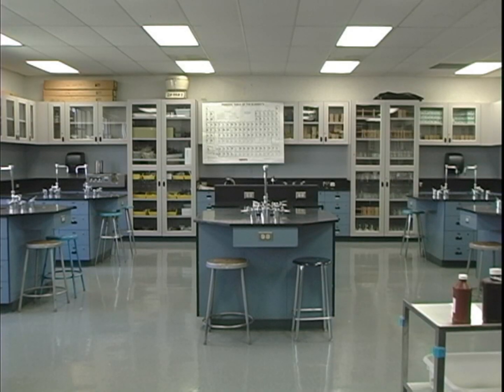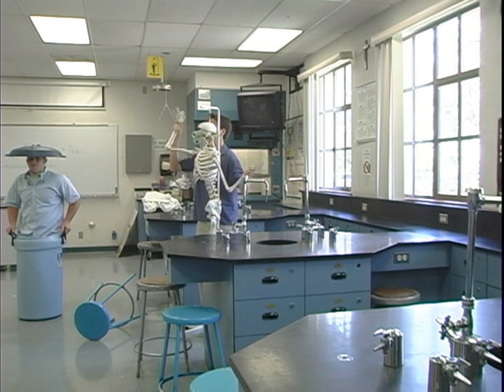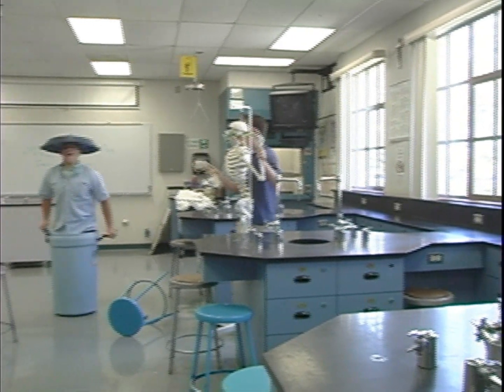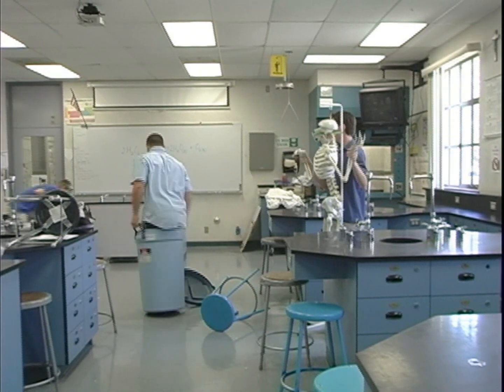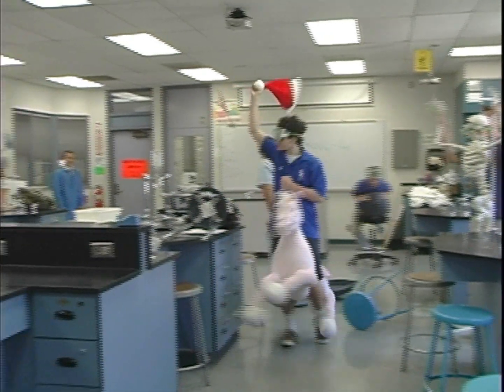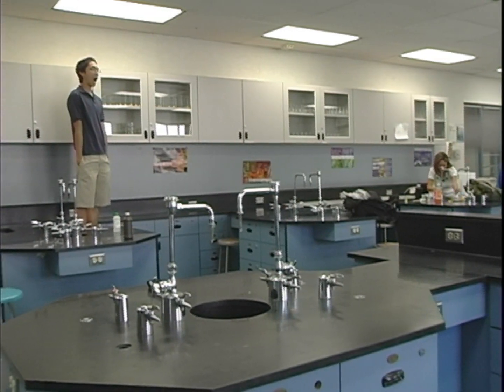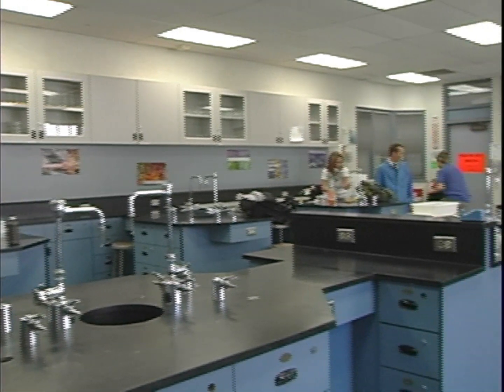Here are some other rules that should be followed to ensure a safe lab. Horseplay is never tolerated in a laboratory. Follow all written instructions completely. Perform only the lab activities for which the teacher has given instruction, and always know the lab procedures before starting the experiment.